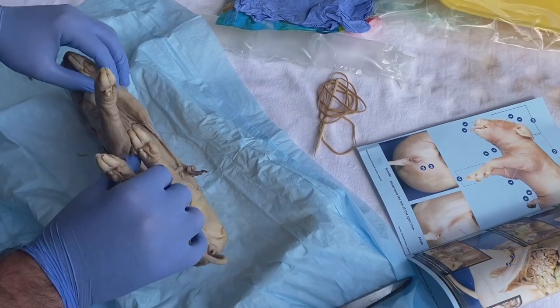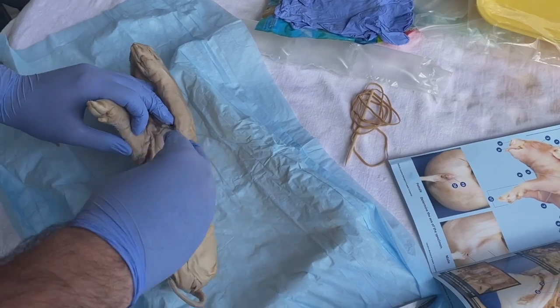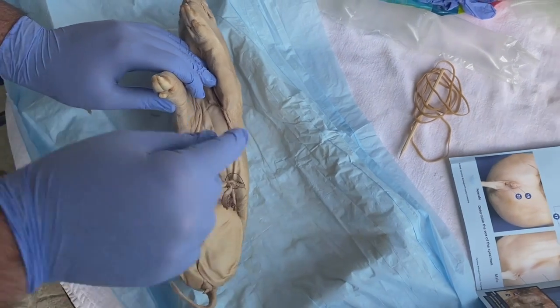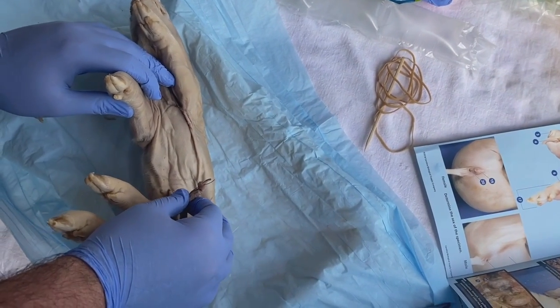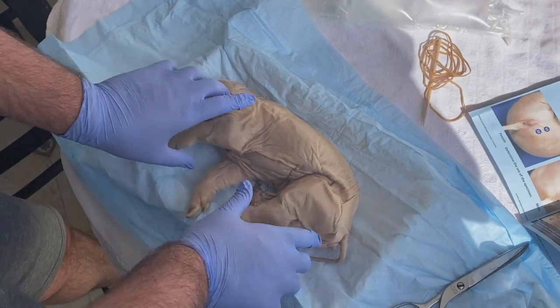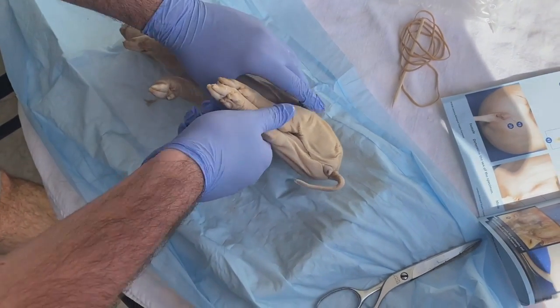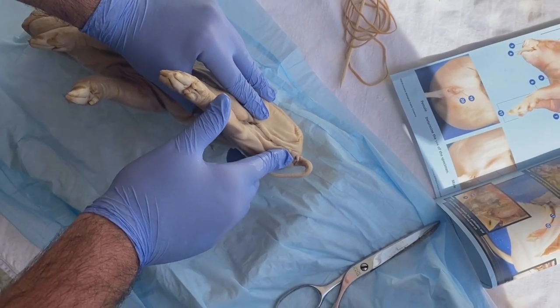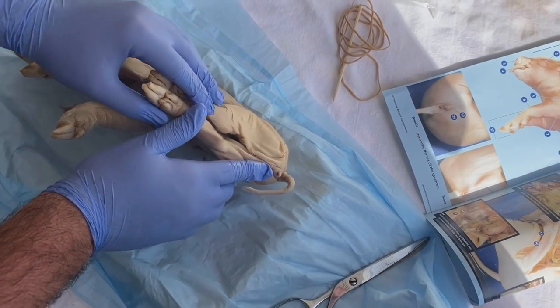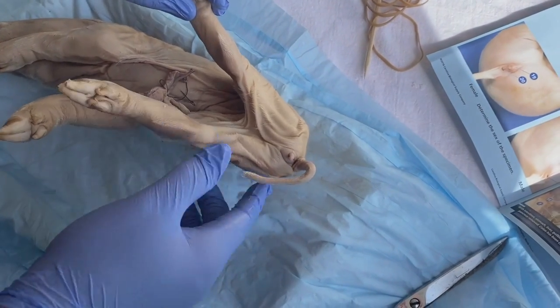And here's the abdomen. Now here are the mammillary papillae, as well as the umbilical cord, which is right here. So this pig is actually a female specimen, and you can tell right here, as we can see, the female reproductive organ, which is also known as the genital papilla, and is protruding from the urogenital opening, which is immediately ventral to the anus. This is by the tail right here.